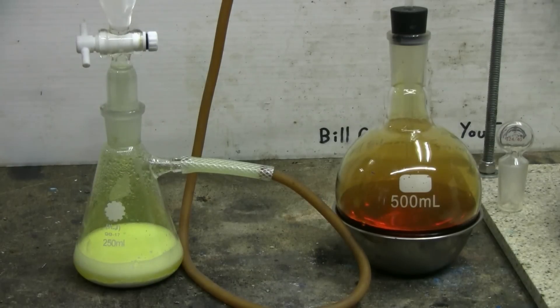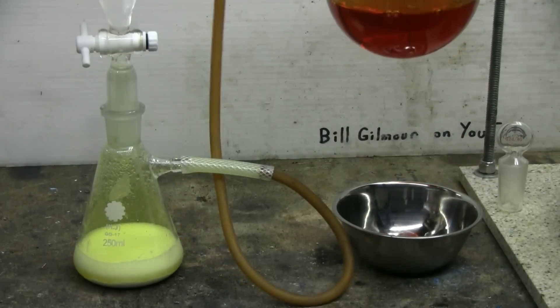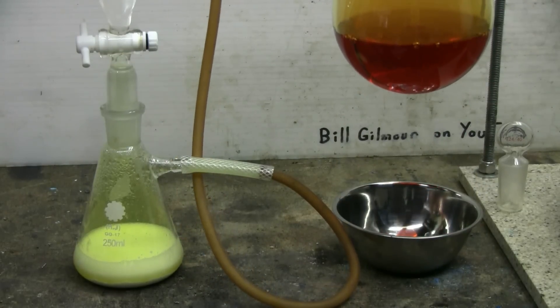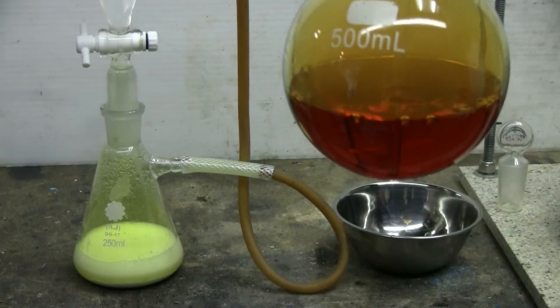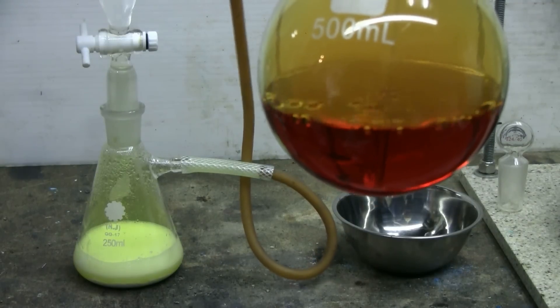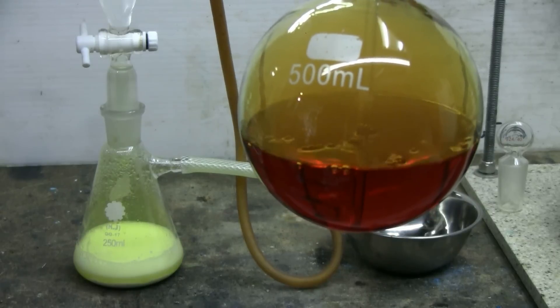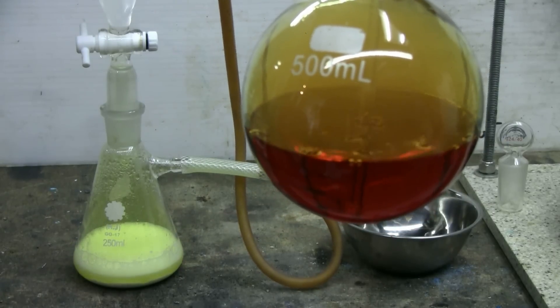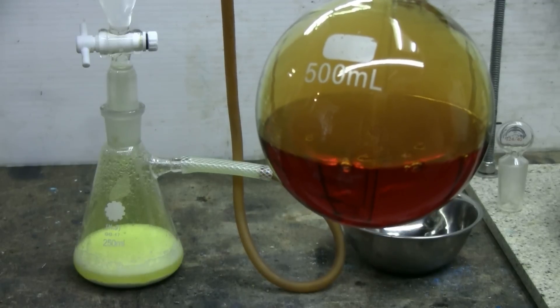The chlorine generator is still working. We're still bubbling chlorine through here. I'm going to bring the flask a little closer to the camera - we can see the bubbling action of the chlorine gas bubbling through the sodium bromide solution.